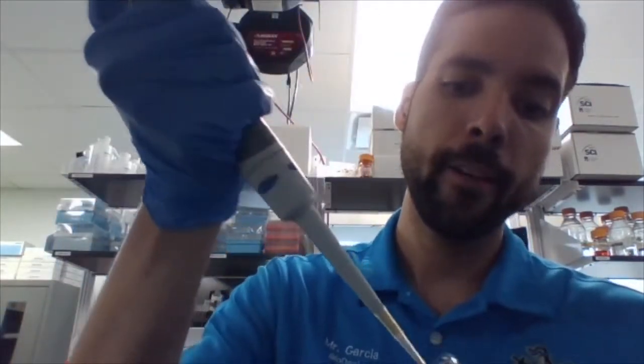And I can demonstrate that very quickly here. I have some water, box of tips, and essentially I just open it up. I have 20 microliters set up. I essentially get my sample, I release the plunger, and there's my 20 microliters. You can actually see what it looks like.